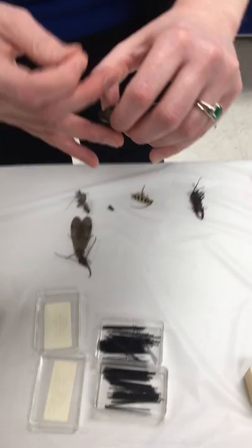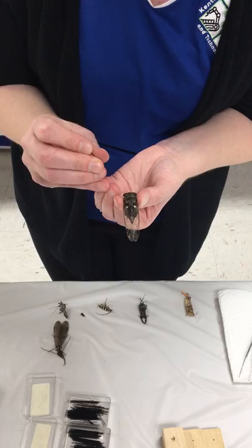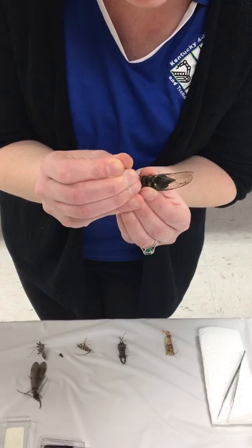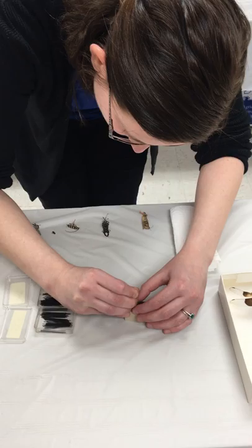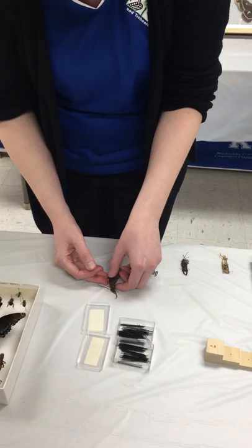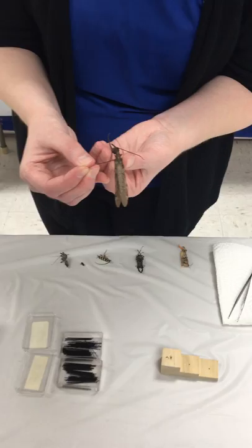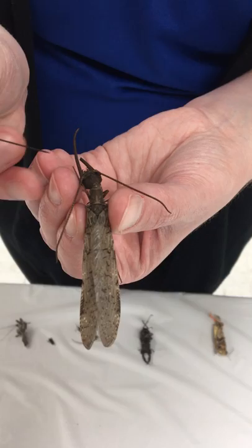Here's a cicada. This particular species has these black markings right here, and I'm going to use those as a guide and try to pin on the right one. For those using a black light trap, this is one species you might find. Next is a Dobson fly — you can see where the wings are covering the thorax and abdomen with a little space between the wings, so I'm going to pin there on the thorax, again a little to the right.